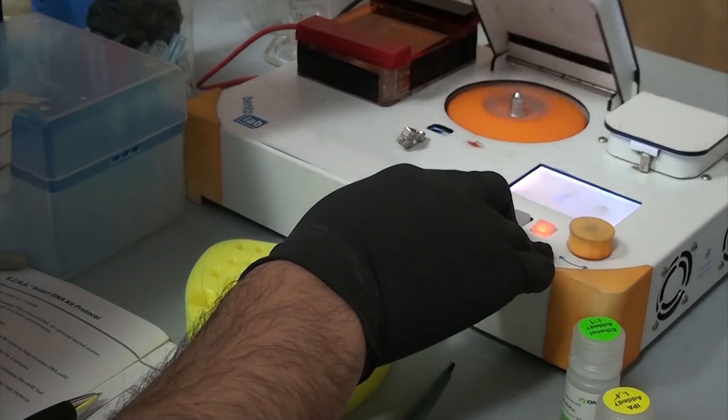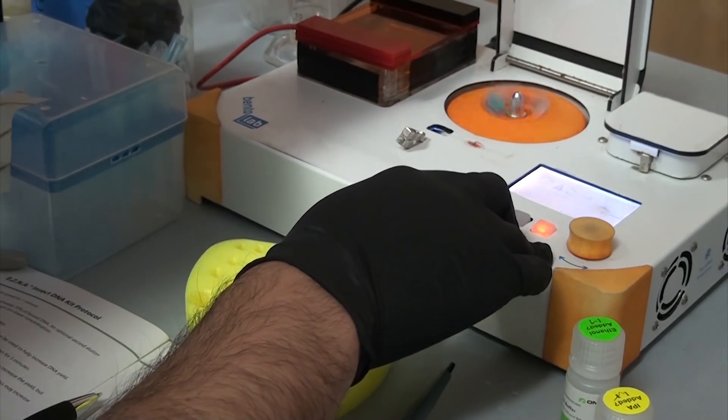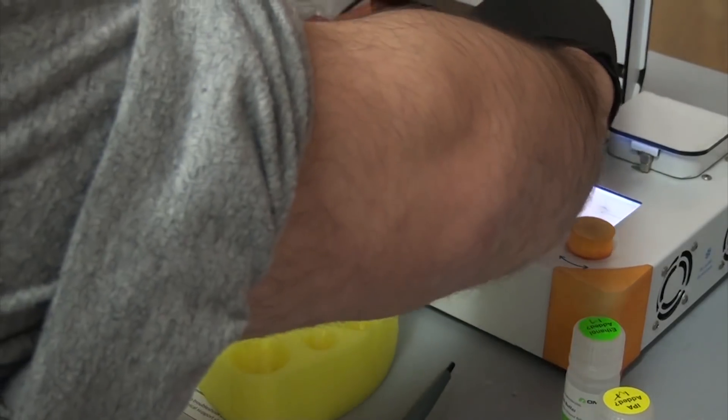As you can see, it's still the same basic process, but because of the tough tissue sample, extra steps and ingredients were needed to get the best results.